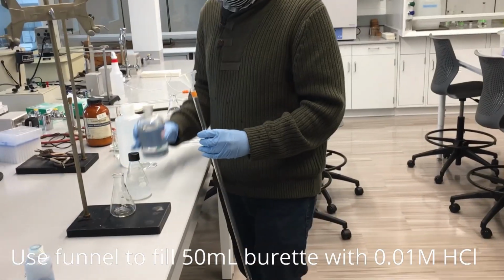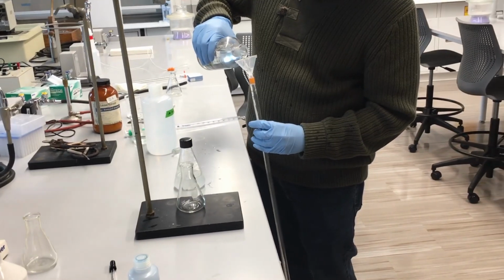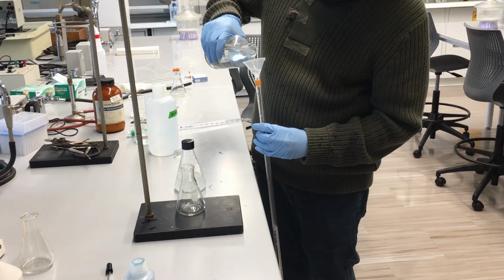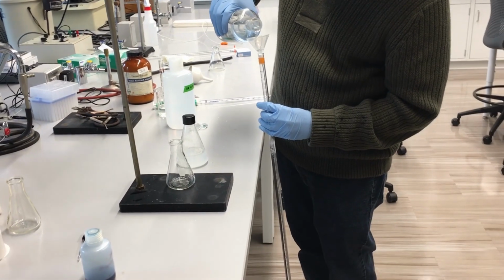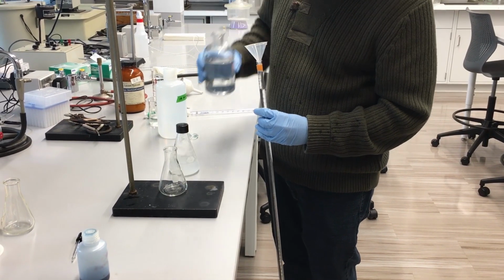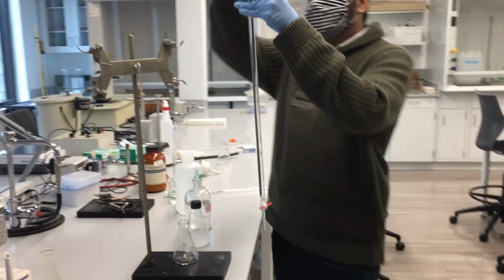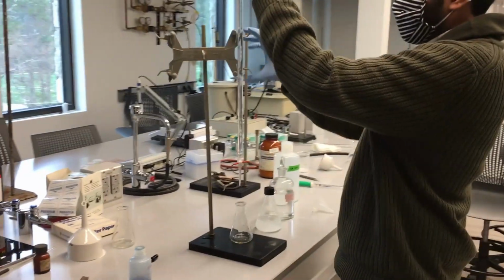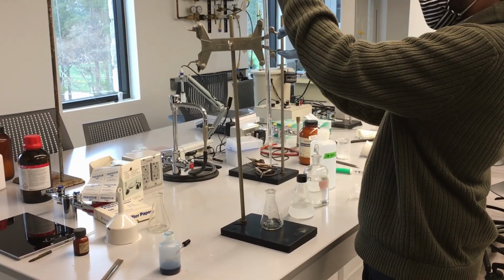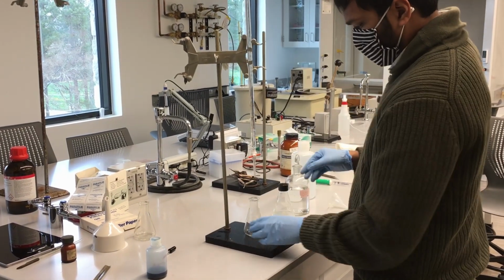Next, we're going to go ahead and prepare our burette for our titration. So we're going to pour 0.01 molar HCl, hydrochloric acid, into our burette. That's going to be our titrant, and we're going to titrate that into our calcium hydroxide solution. So the H+ from the HCl will neutralize the OH- from the calcium hydroxide. So we'll go ahead and set up our burette.